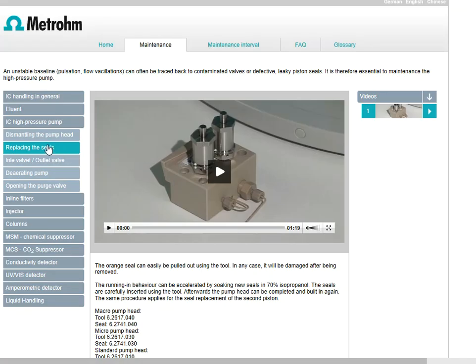So in the previous video, we already talked about dismantling the pump head. We saw how to take that piece off, and then we saw about replacing the seals. We saw that the pistons were unscrewed. We used that specialized tool to pop down in there and screw and pop out that seal. And then we took a new seal that was clean, used a guide tool to put it where it needed to go, and then we just pushed and popped it into place.